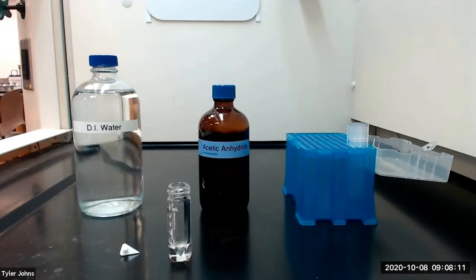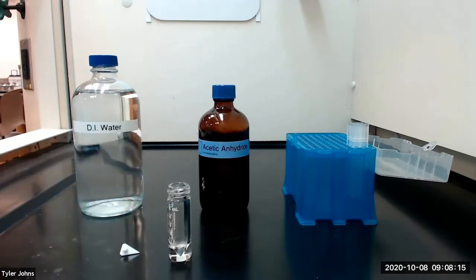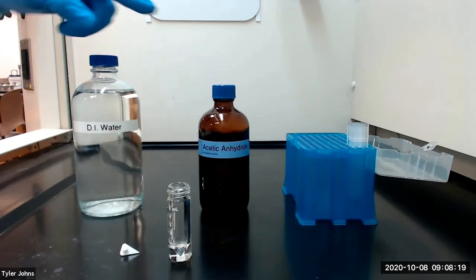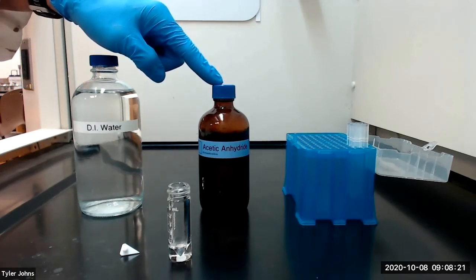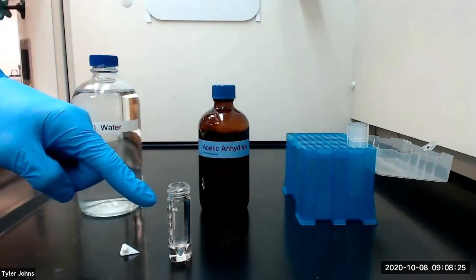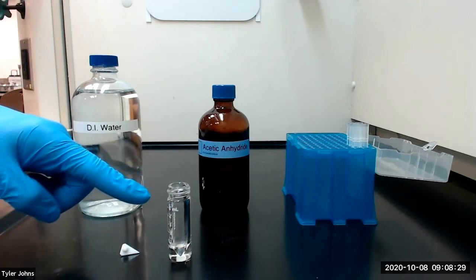We've transferred our P-aminophenol to our 5 milliliter conical vial. We're next going to add 450 microliters of deionized water and 165 microliters of acetic anhydride to the P-aminophenol in our 5 milliliter conical vial. We will also add a spin vane to our conical vial.